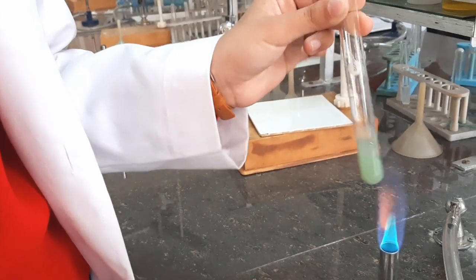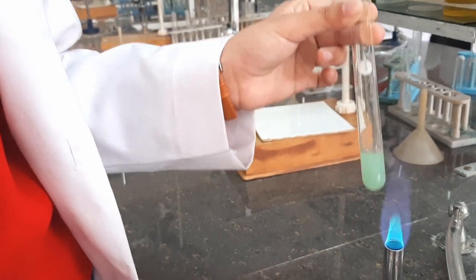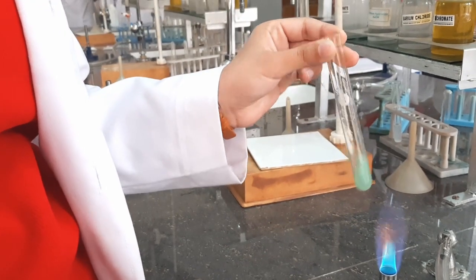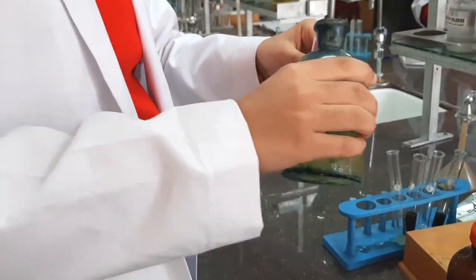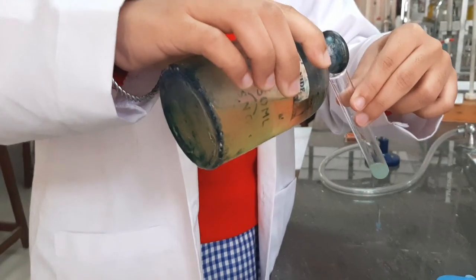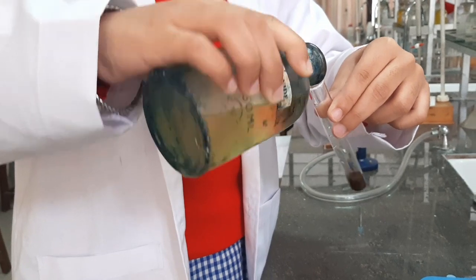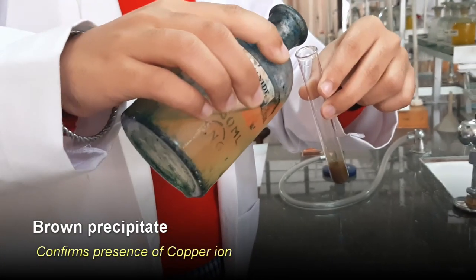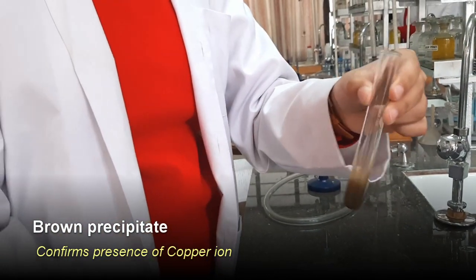The solution turns sea-green. Now we are going to divide this solution into two to do the two confirmatory tests. To one part, add potassium ferrocyanide — a brown colored precipitate confirms presence of copper ion.